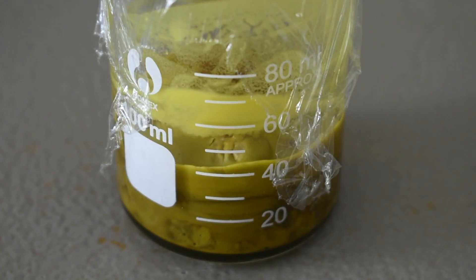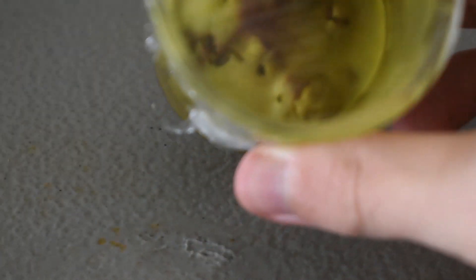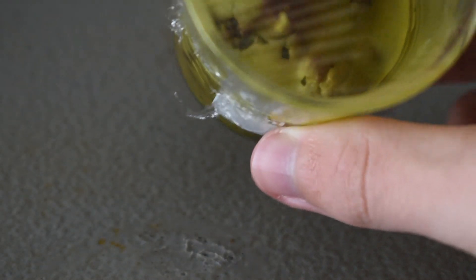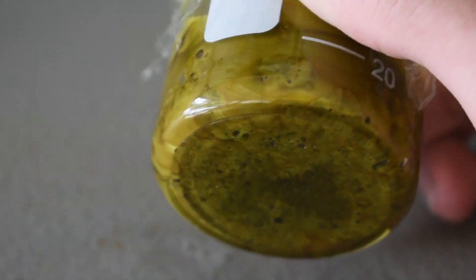So I've let it sit for about half an hour. And all of the pyridine has kind of incorporated itself into this mess at the bottom of the beaker.